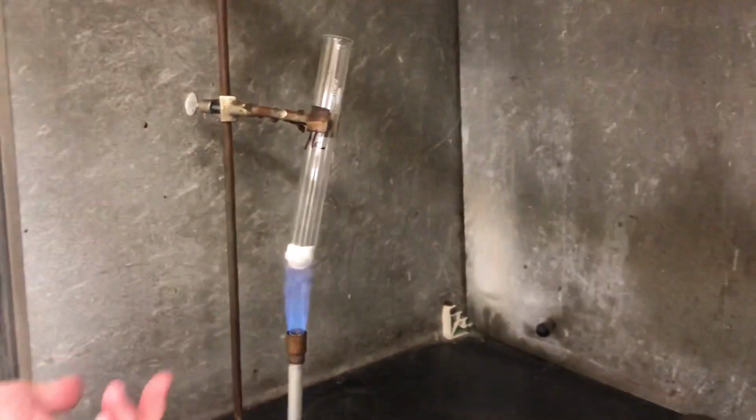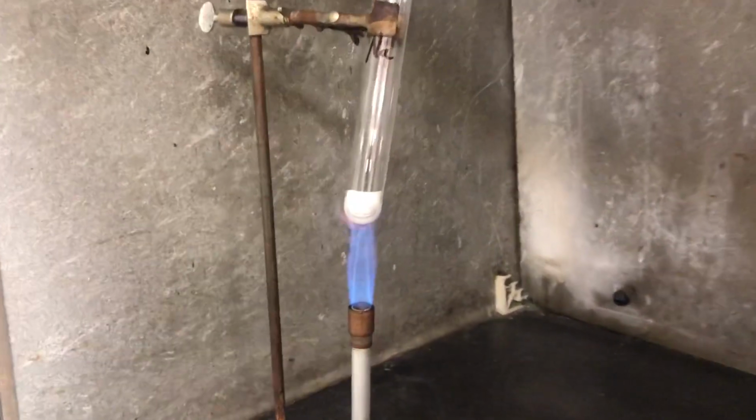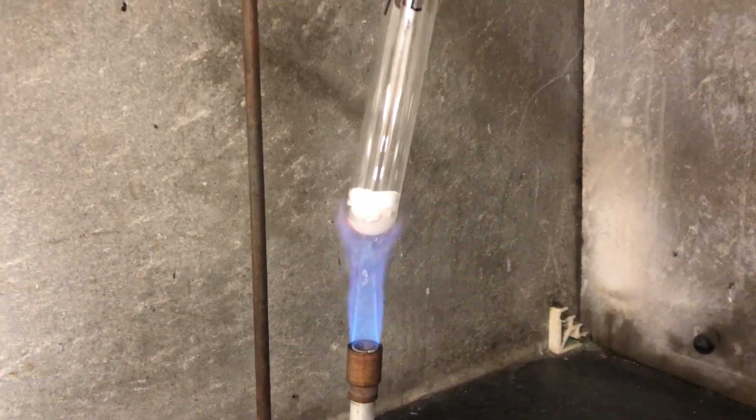You can see some of the residue of the salt that splattered on the back. That was not there in the beginning, so that's what's going on with that. And you can see the incomplete combustion of some of the sugary compounds. But we got the same thing going on over here with the sodium chlorate. Again, it's doing its thing. It's taking a few minutes to melt.